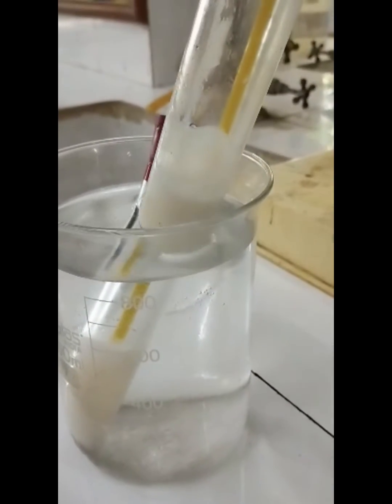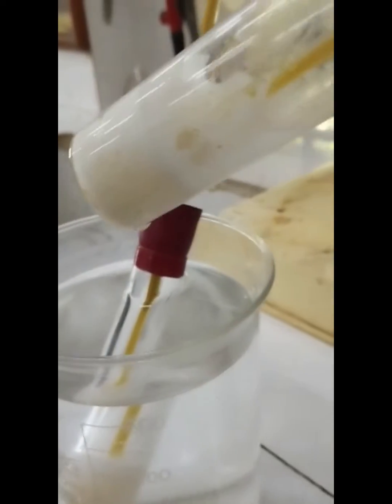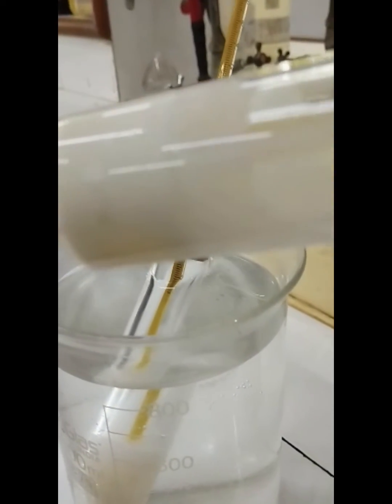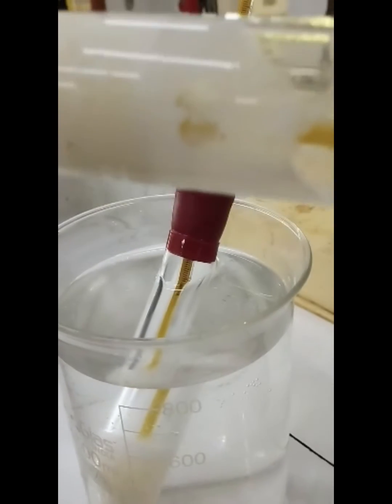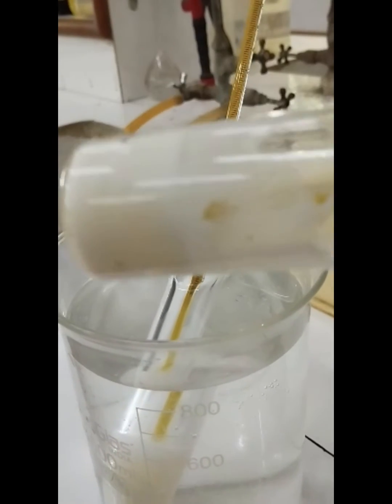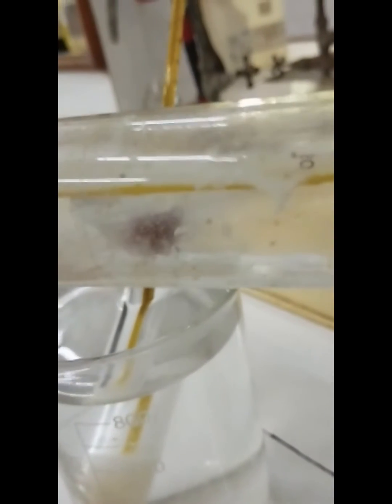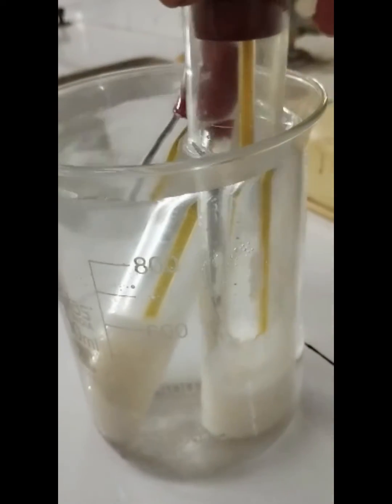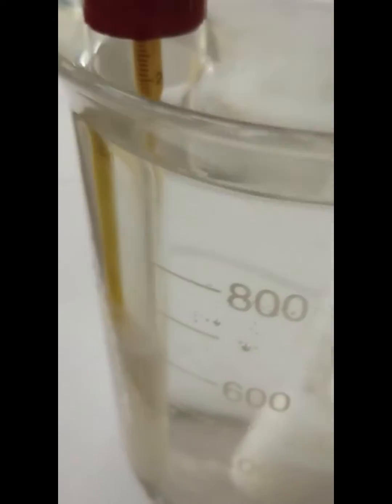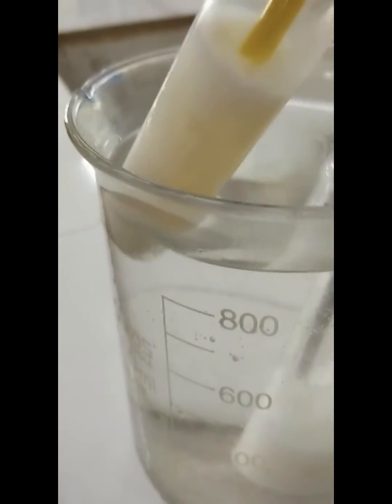We have already noted the cloud point — the temperature at which we first observed a cloudy or hazy appearance. Now what we have to note is the pour point. As discussed in my previous video, pour point is the temperature at which the oil ceases to pour. For that, you have to tilt the tube just like I am doing right now. If you see that the lubricating oil is still flowing, you have to put it back and further cool it until it ceases to flow, until it stops pouring.